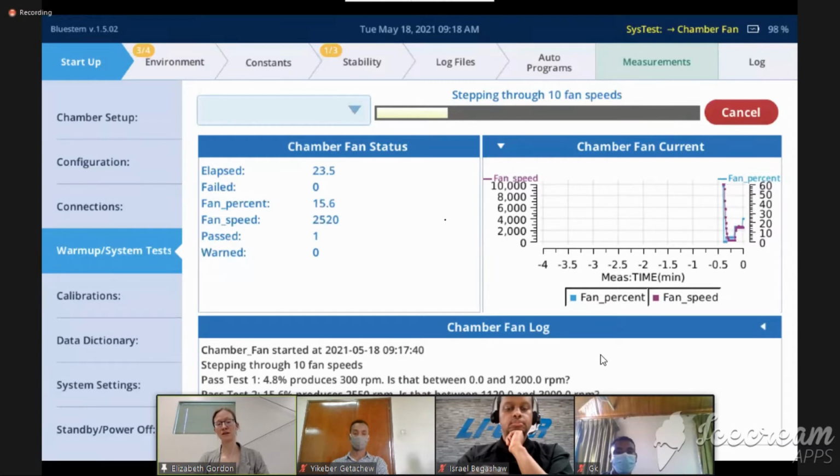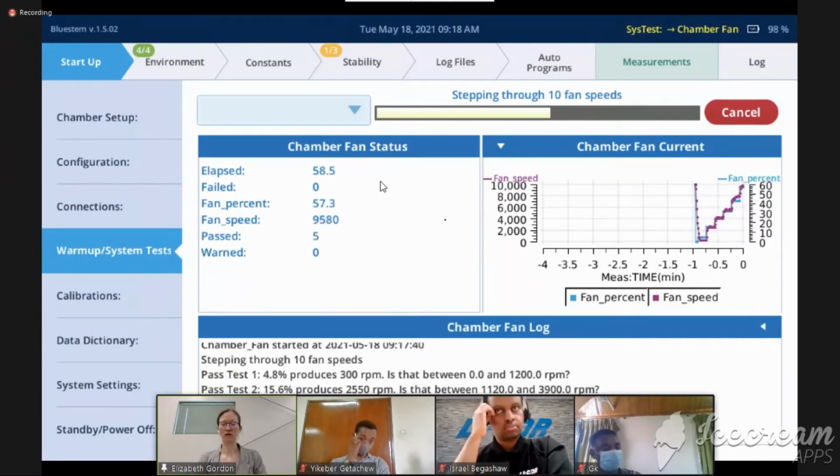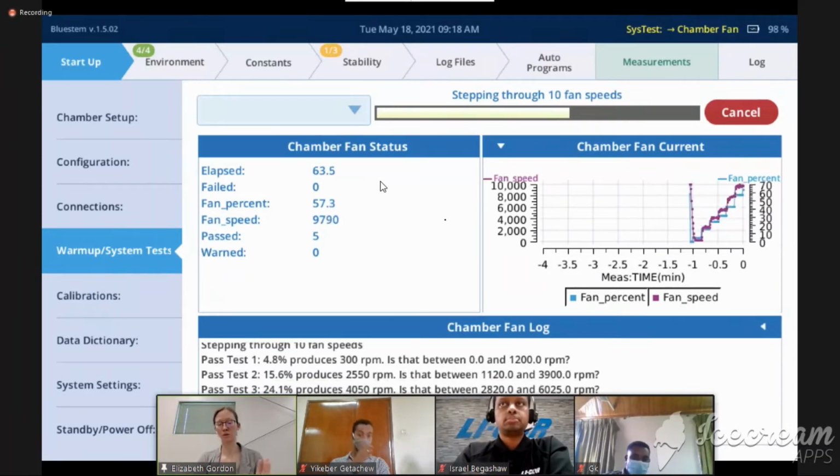So you can see that this set of warm-up tests in 10 to 15 minutes allows us to find out exactly what is going on with the instrument. If we went ahead and started our measurements without them, we would have the possibility that there was a problem and we didn't know about it, and then our data didn't look good or was completely unusable. So we don't want to ever be in that situation. We always want to run the warm-up tests before we start our measurements.